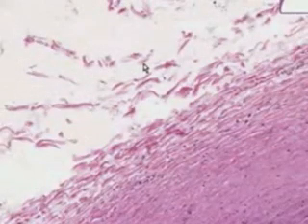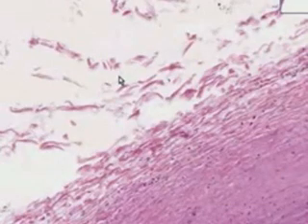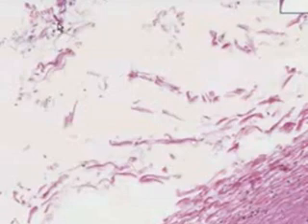And last but not least, in the loose connective tissue of the adventitia, besides having a classical appearance of loose connective tissue, you can see perhaps some fat, some other blood vessels, and let's see if we're lucky enough to find a nice vasa vasorum here. Oh, maybe not, but you can be sure that they're there. This is the classical model for all of the larger arteries.